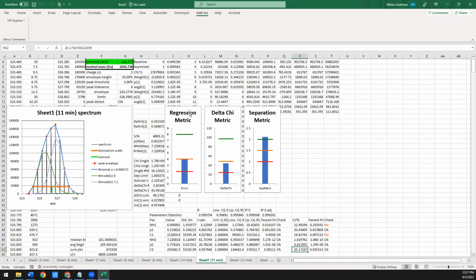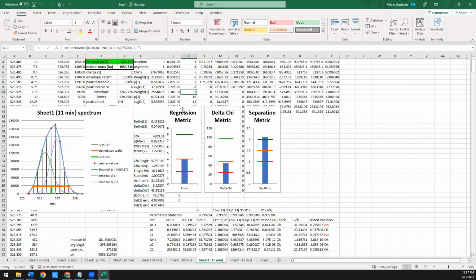And that's actually what is embodied here in this first additional graph that popped up. So this bar graph basically represents how confidently it was able to fit all of these parameters. The higher the bar, the better it was able to fit, and the higher confidence you have. These 3 horizontal lines represent confidence intervals. The green would be 99%, the orange is 95%, the red is 80%. So the height of the bar here is basically how confident you are in these values. The other 2 graphs that popped up are used as secondary ways to assess whether you can trust those parameters from the fit or not.